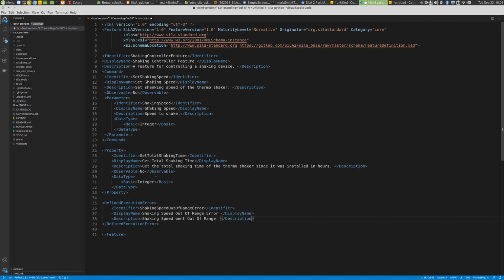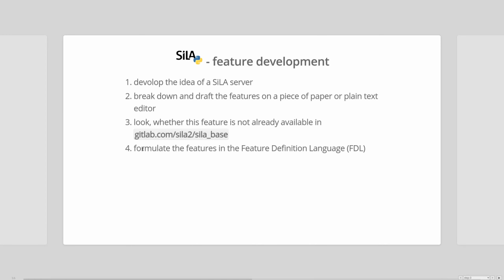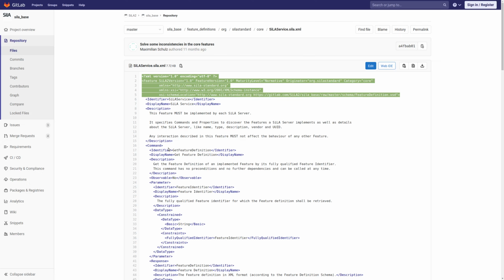Okay, so by that we have a very simple shaking controller feature specified, and that we can then use in further processing. Let's just go back to our presentation. So you see this informal notion of your features went into a formalized way with XML syntax. By the way, this XML syntax can then be validated against our feature definition schema, which you find on our SiLA base repository.